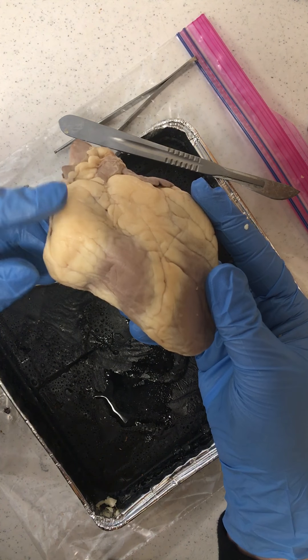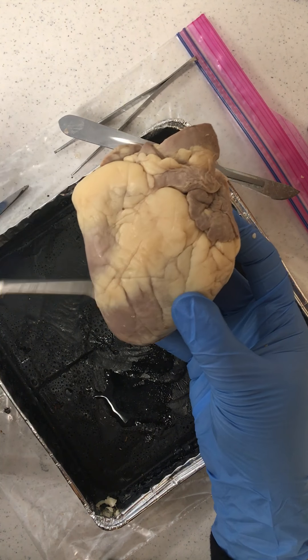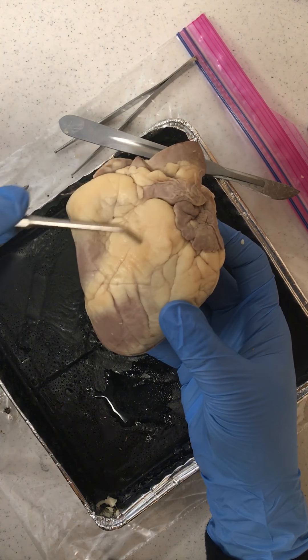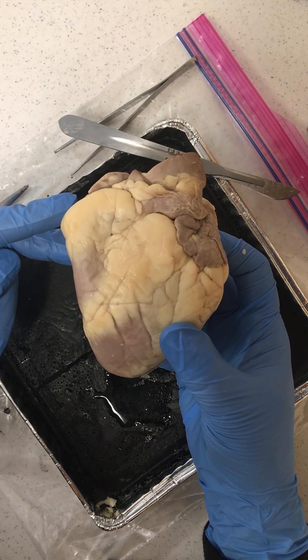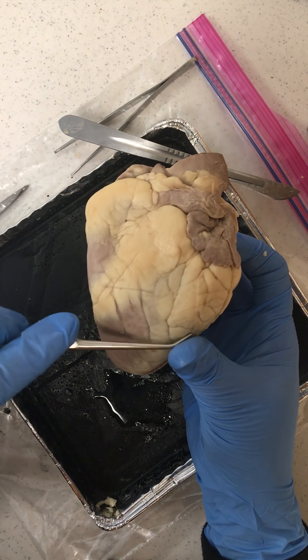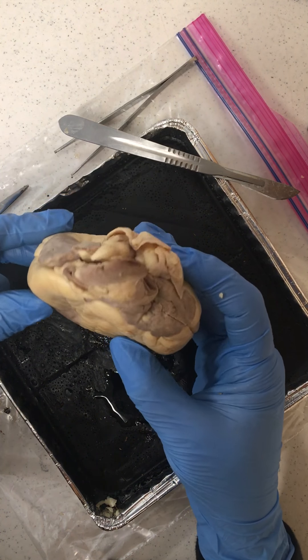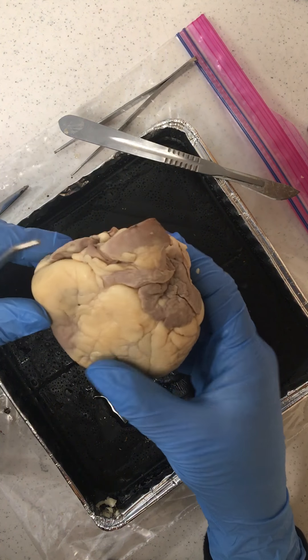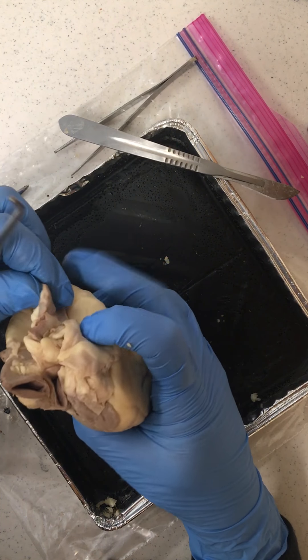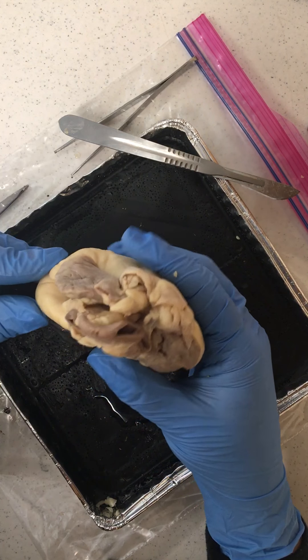You'll notice here a couple of different structures. This thick wall throughout the middle which separates the right side of the heart from the left side is known as the interventricular septum or sulcus. These coronary arteries are what get damaged during heart attacks. Other things to notice are the pulmonary trunk, the aorta, and some other pulmonary veins and arteries coming through here at the base.